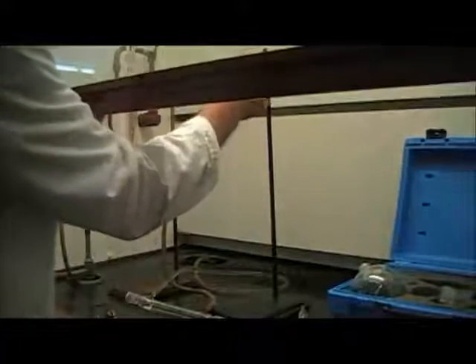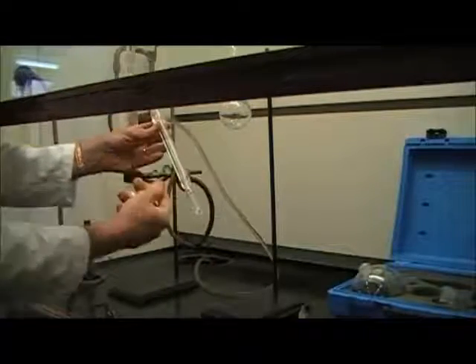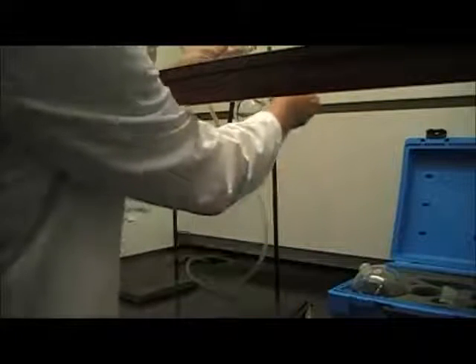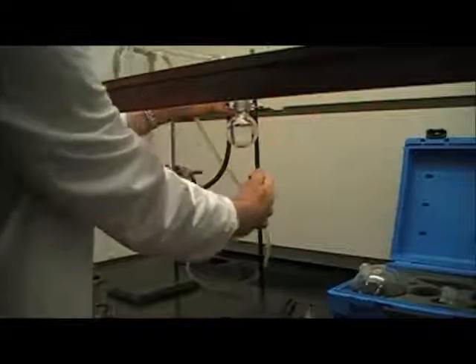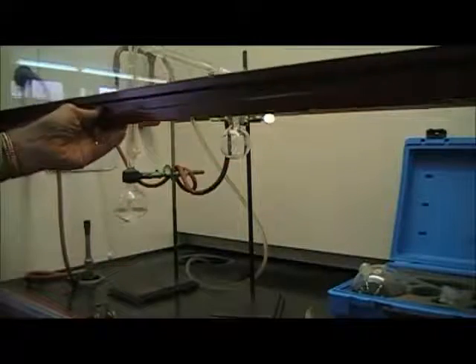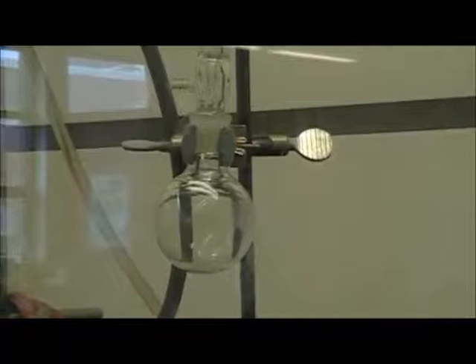Again, I'm going to put the collection adapter in there. I'm going to attach my condenser, which still has water flowing through it. I haven't changed that at all. This is the hard part is getting the pieces aligned exactly correctly. Now the apparatus is set up where there's a round bottom flask with the boiling chips, the column, the still head with the thermometer in it, the condenser attached using the collecting adapter, and there's my collecting flask.